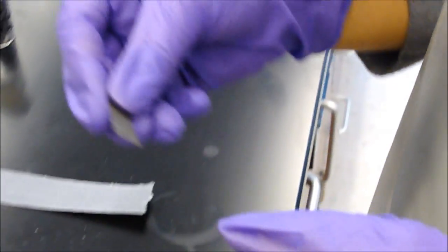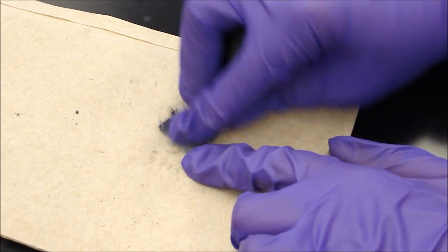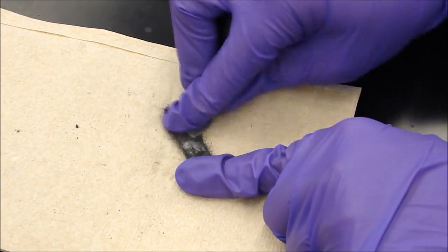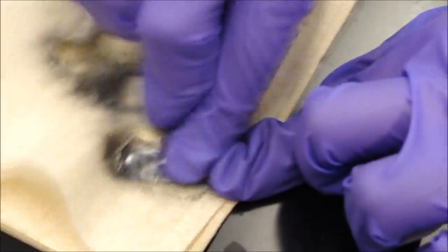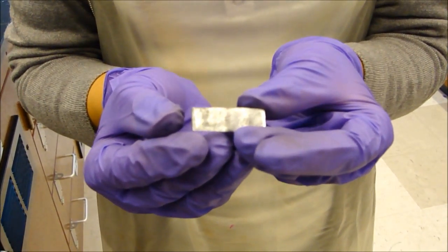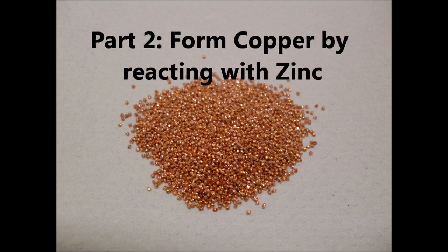The best way to do this is to place the zinc strip on a paper towel on the table. Sand one whole side of the strip against the table and flip it over to do the same until the whole strip shows metal. Try to expose as much metal as you can. It should look similar to this. Now you can drop the zinc strip into the solution.